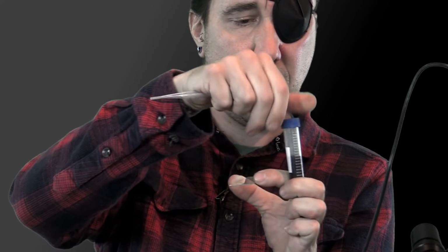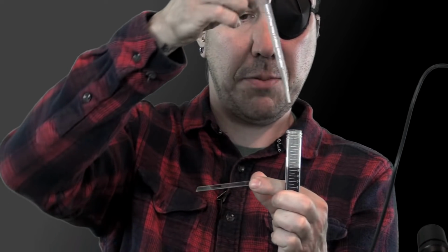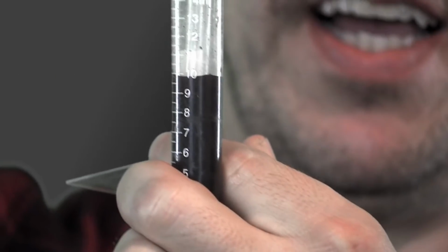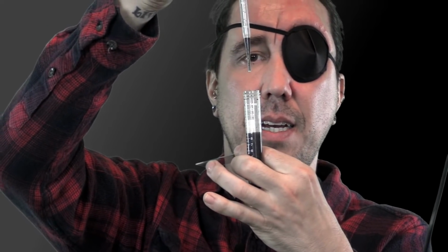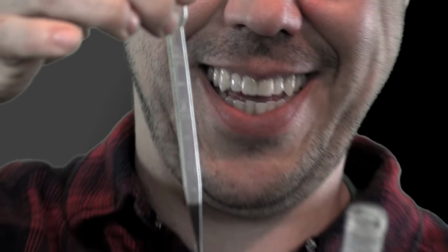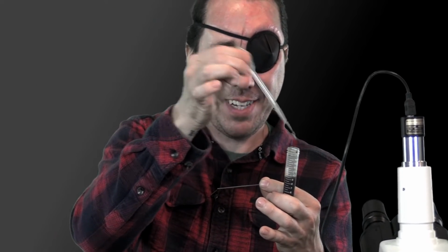So slide, pipette, 1 to 10 dilution. And I have one eye, so I have no depth perception. It's really hard for me to do this. I had mentioned I go down halfway and pull a little bit out. I sit here for a couple seconds and let any big chunks come to the bottom. Pop them out, and then put a drop on your slide. Squirt the rest of that back in there.